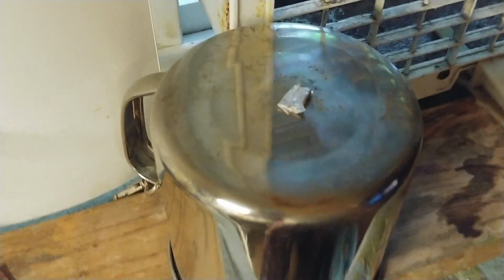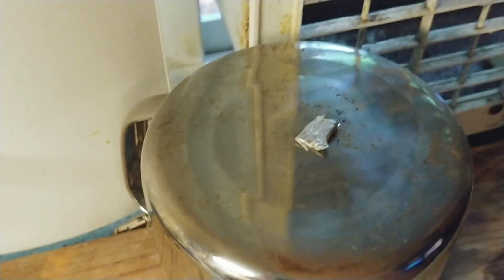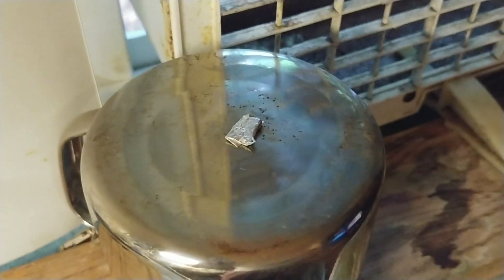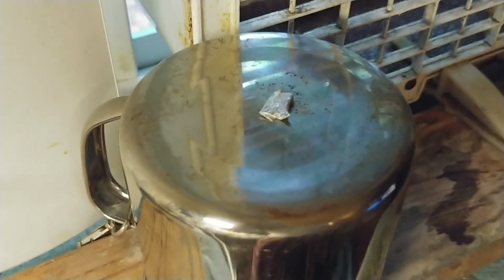I decided how I'm going to get rid of the rest of that acetone peroxide, and I figured I'd film it. I poured the rest in this piece of foil and carefully got it folded without using my fingers, because I don't know if this stuff would explode. But anyhow, I decided since my other video was long and boring, I would make this one.